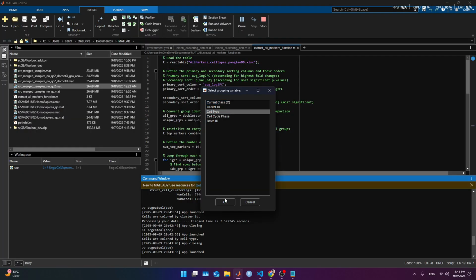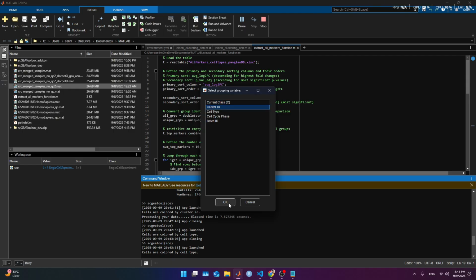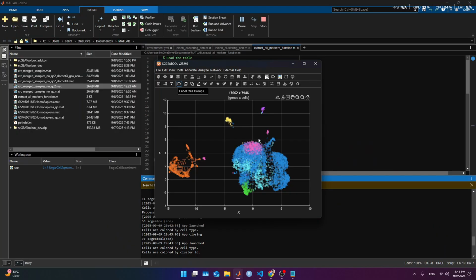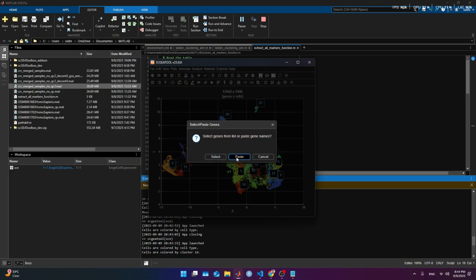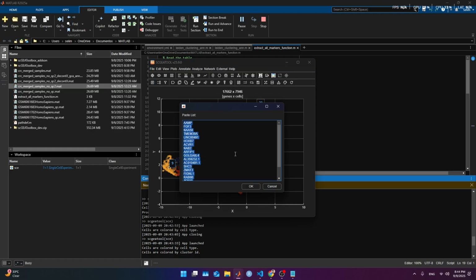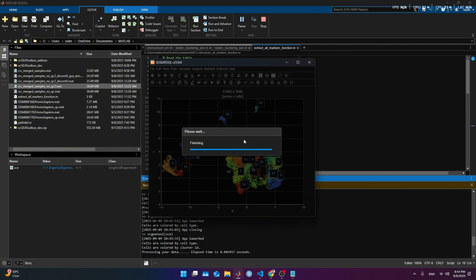And we had these cell types, more or less. That's what we could refine to this point. And we have these cluster IDs. There were plenty of them, which help us to identify some clusters and their gene signature. And before, I pointed out that it's possible that this sample is contaminated because everything is EpCAM positive. That means all those here are colonocytes, exactly what we are looking for.